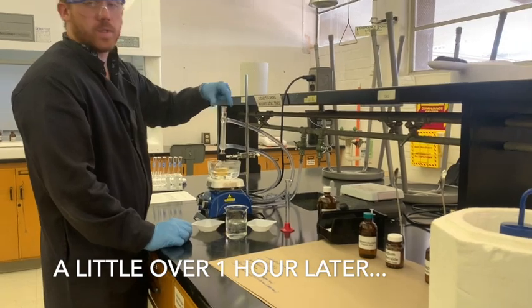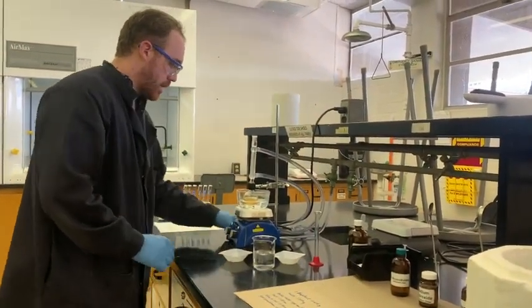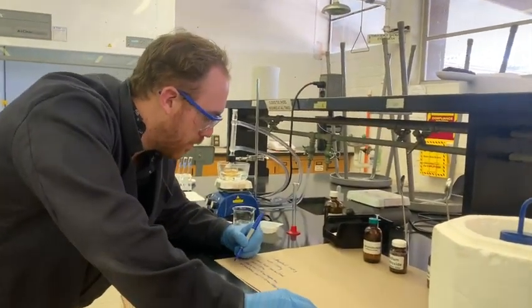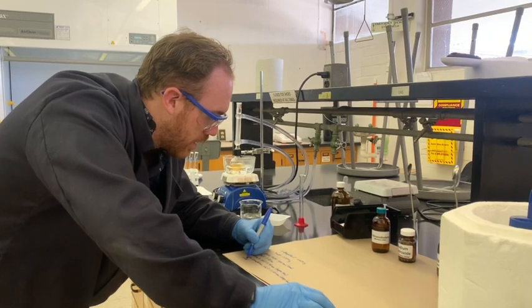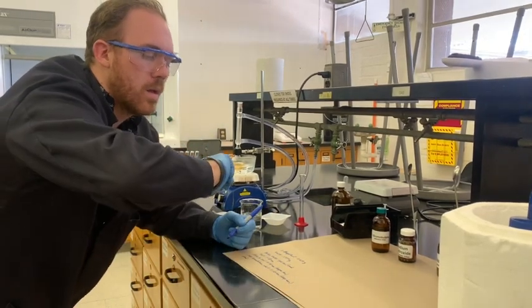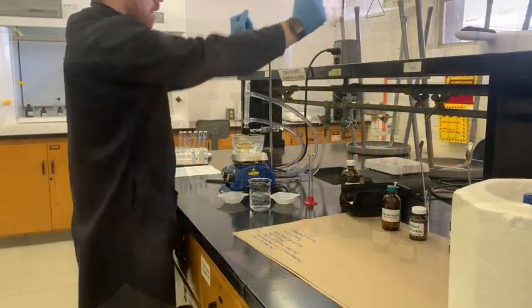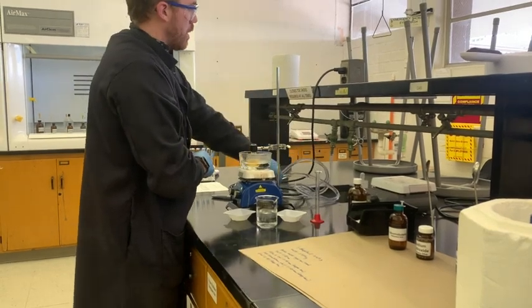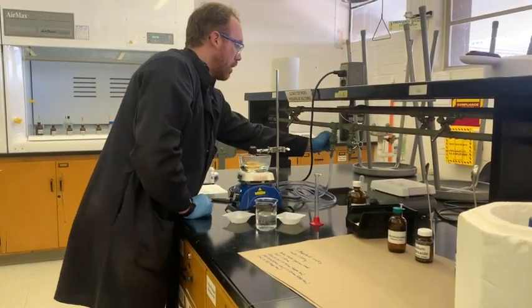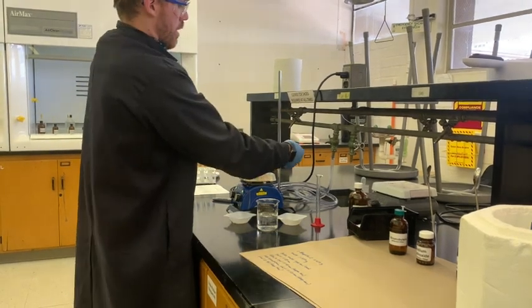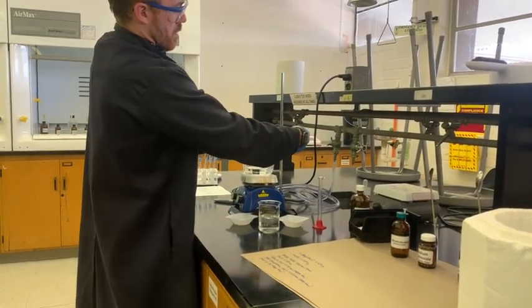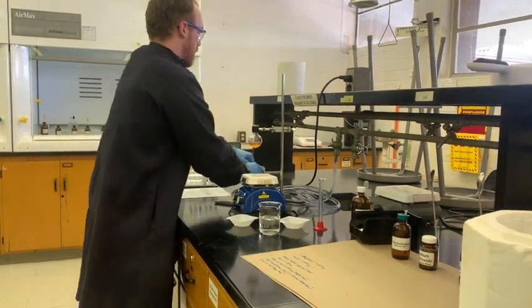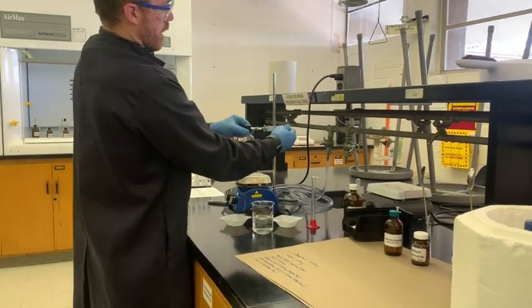So we are going to call it done on this reaction. It is a little deeper in color, more like a dark tan. We're going to end at 12:45. So we're going to pull out the reflux condenser. You can turn it off, and then this is going to be a little volatile and smelly. That's all right. It's not too bad.